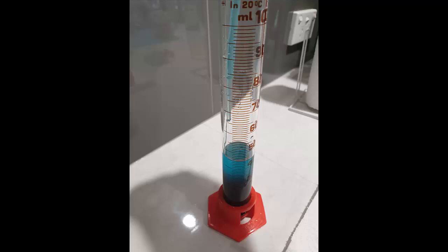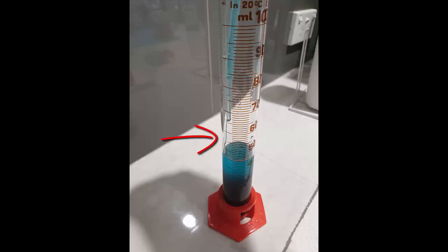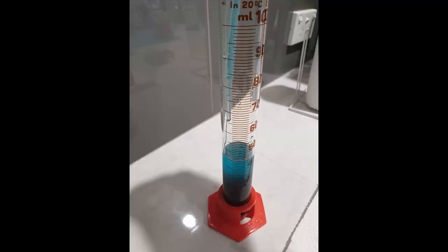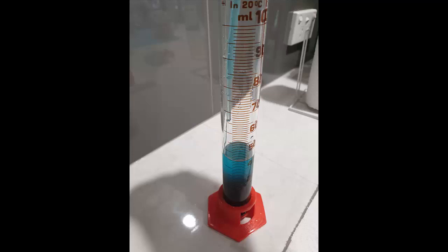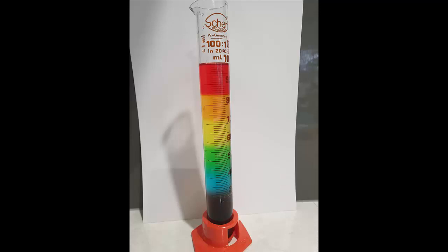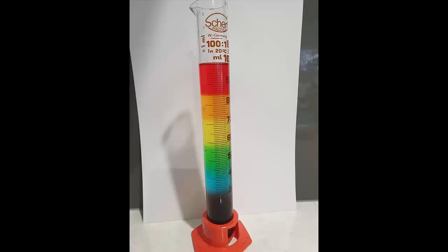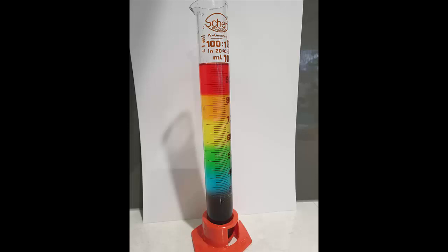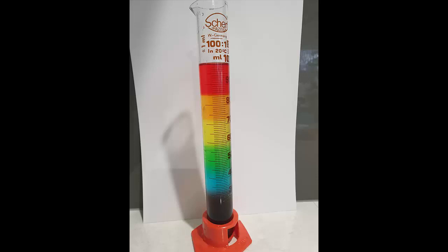It wasn't that slow — it was streaming out — but that was fine. I didn't use temperature to do these layers because I knew it would take too long, the temperature would dissipate, they'd become the same temperature and that would mess things up. So I went for density layers rather than temperature layers. You could improve it further by keeping the bottom layer cold and insulated and using a hot water bath for the top layer, but temperature is trickier. Using density for the layers is easier than using temperature.